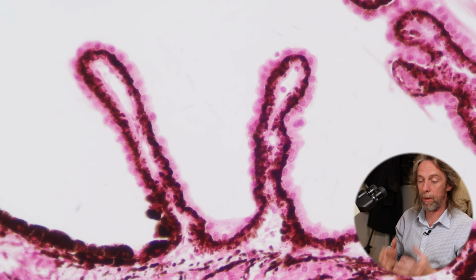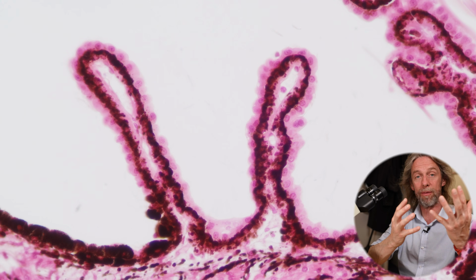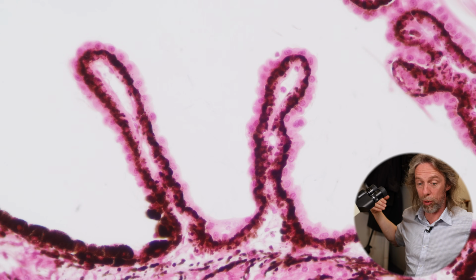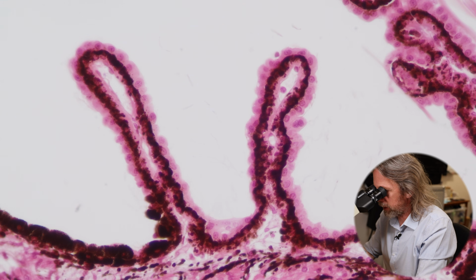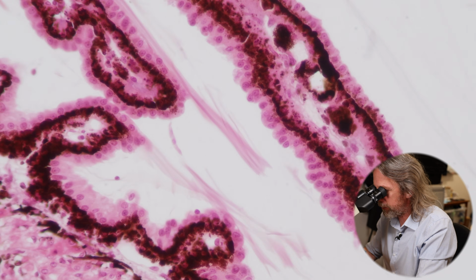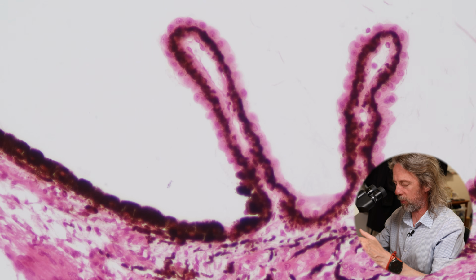And the cells of the ciliary processes are producing aqueous humour constantly. They make less of it when you're asleep, I think. They make more of it first thing in the morning, but they are continuously making aqueous humour, and that aqueous humour is going into the posterior chamber of the eye. So these cells look cuboidal here, or maybe short columnar. Oh, those look more columnar over there, don't they? That epithelium is often a simple columnar epithelial layer in humans. I don't know what animal this is from.